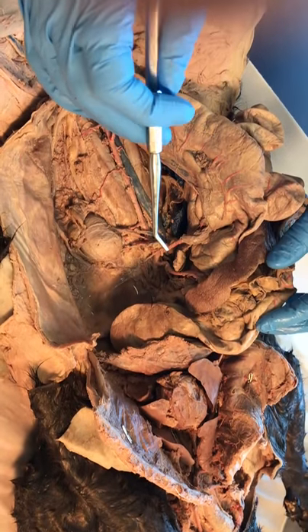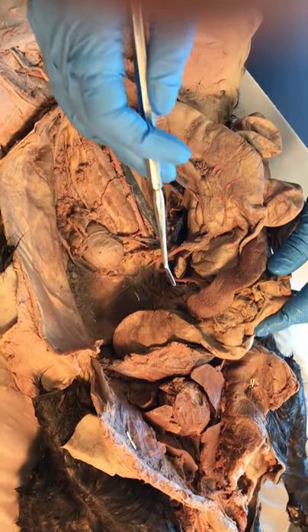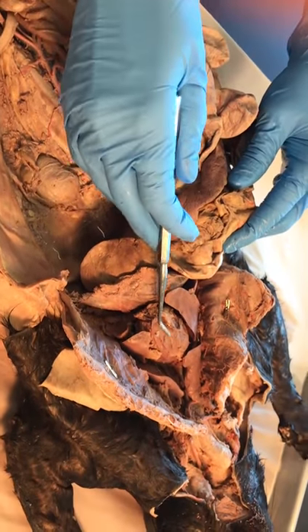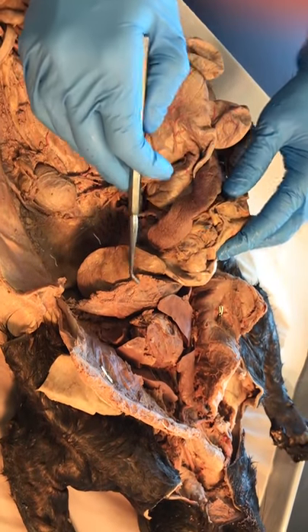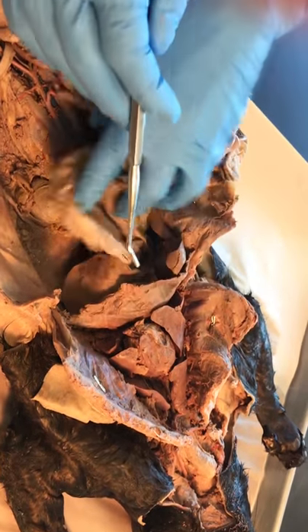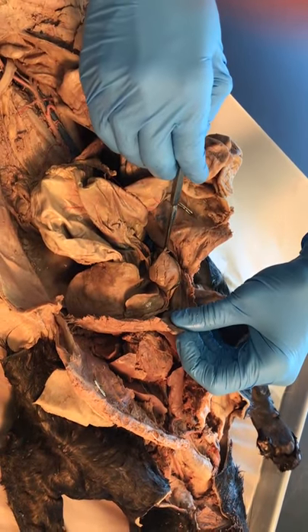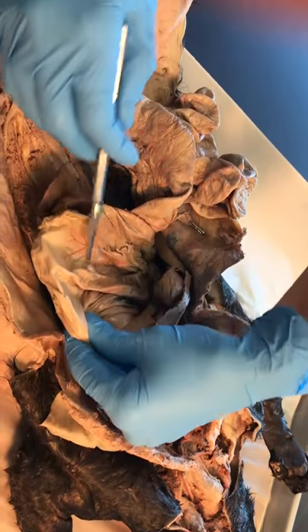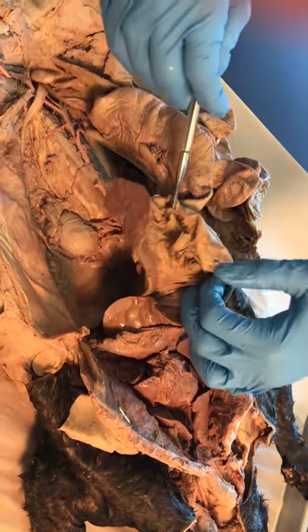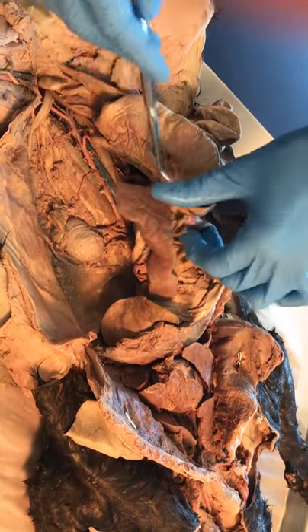Let's look at the veins below the diaphragm by first reorienting ourselves to the structures we can find. Here is the heart, here are the lungs, here's the diaphragm, here's the liver on the right side, here's the stomach on the left, and here's the spleen on the left side of the stomach.